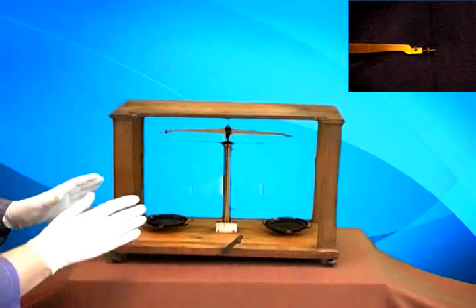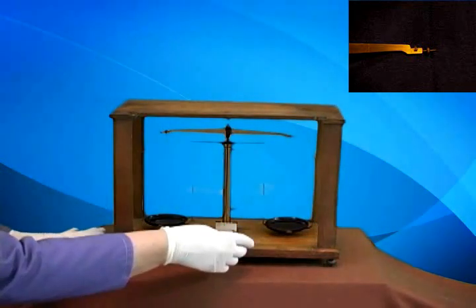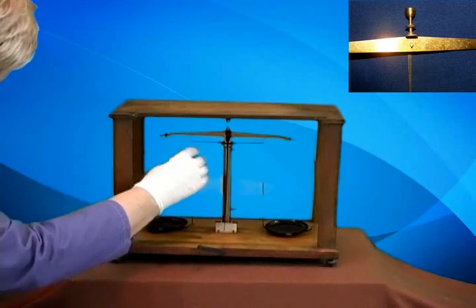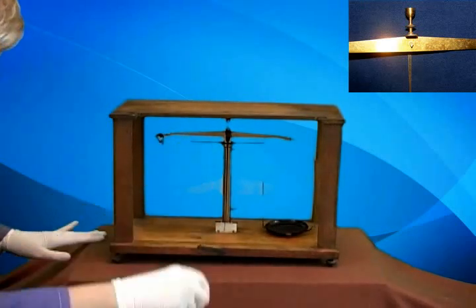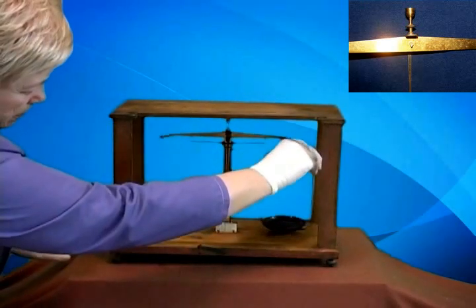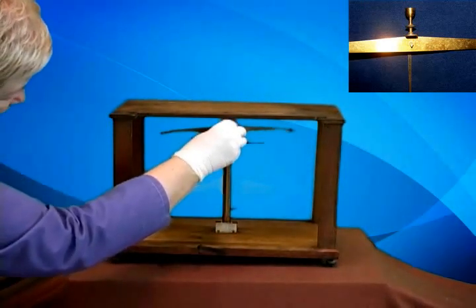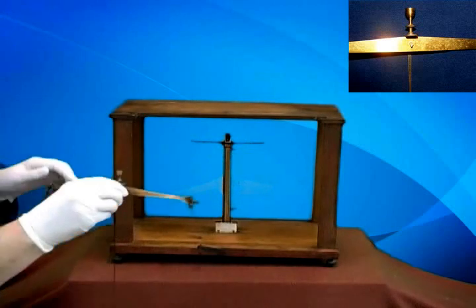Well, I want to show you the knife edges. And to do that, I'm going to have to take the balance apart. So, I'm going to reach up here and remove the pans, and then bring out the beam.